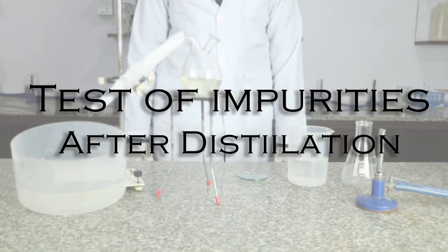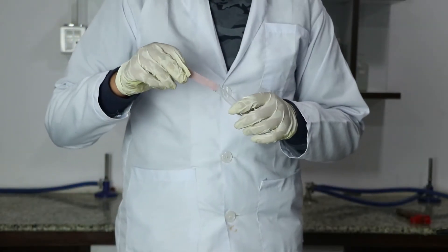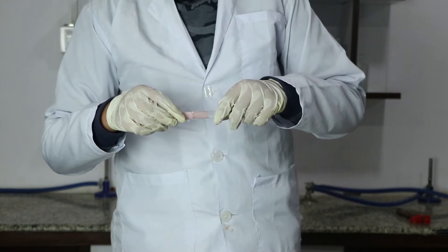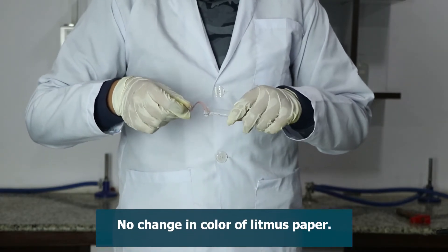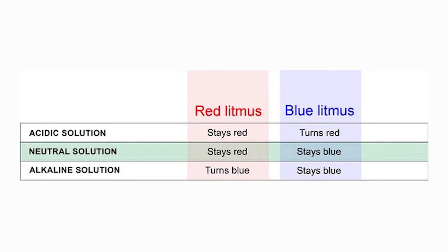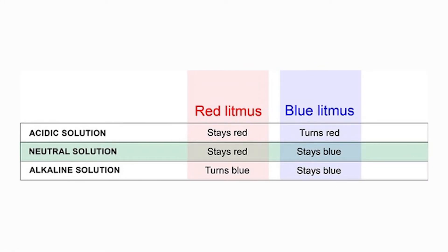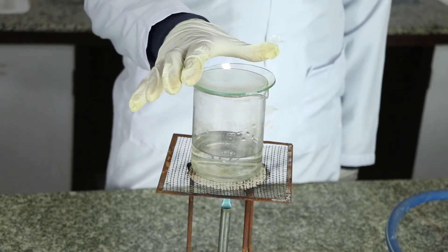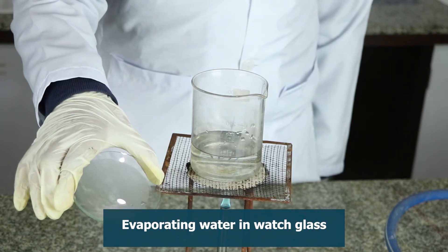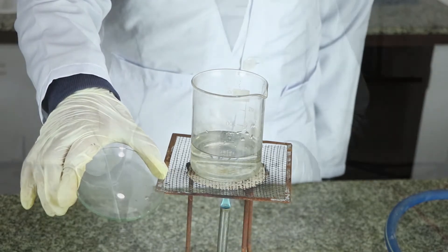Test for impurities after distillation: take a few ml of distillate in a test tube and test the sample with litmus paper. There is no change in the color of litmus paper, which means that the distillate is neither acidic nor basic. Repeat the residue test as before. No solid residue is obtained after evaporation, which shows water is free of solid particles.